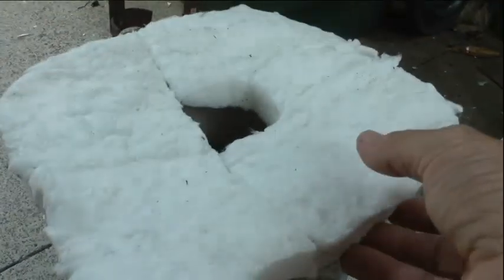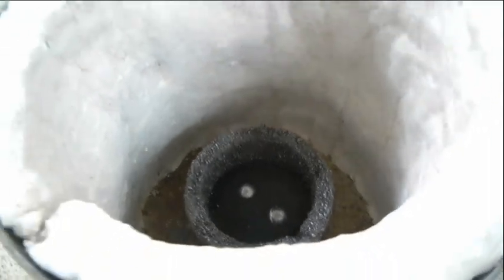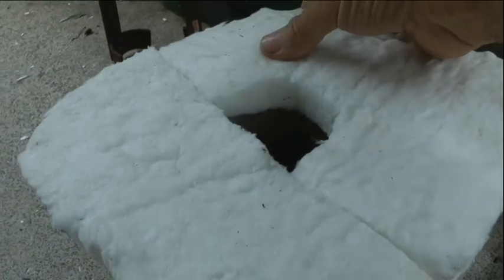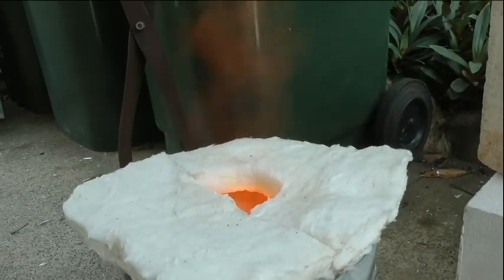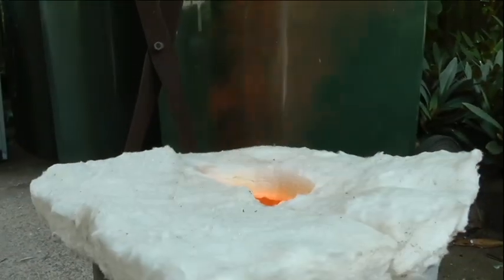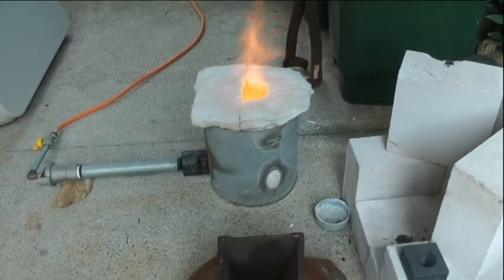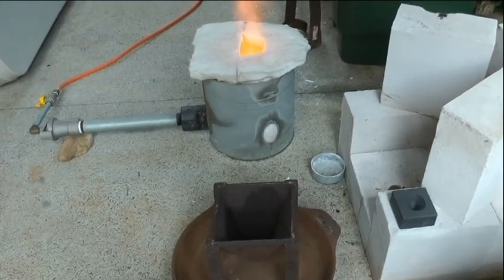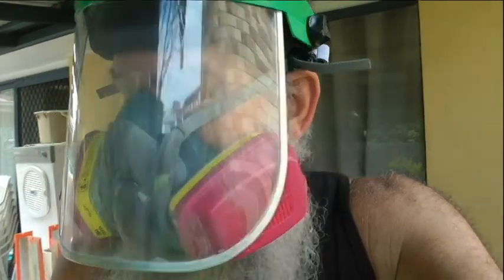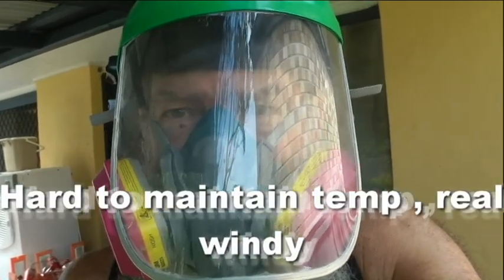Right, I've got a crucible in the furnace here, with a couple of lead pills in there. So I'm going to fire that up and then tip it into a conical mould and see if we get anything out of it. I'm having trouble keeping the temperature up because it's a real windy day. Real windy, blowing a gale out. So yeah, struggling to maintain temperature.